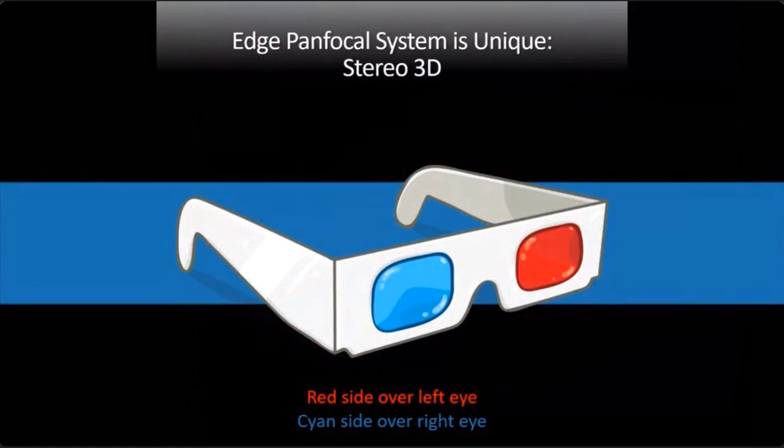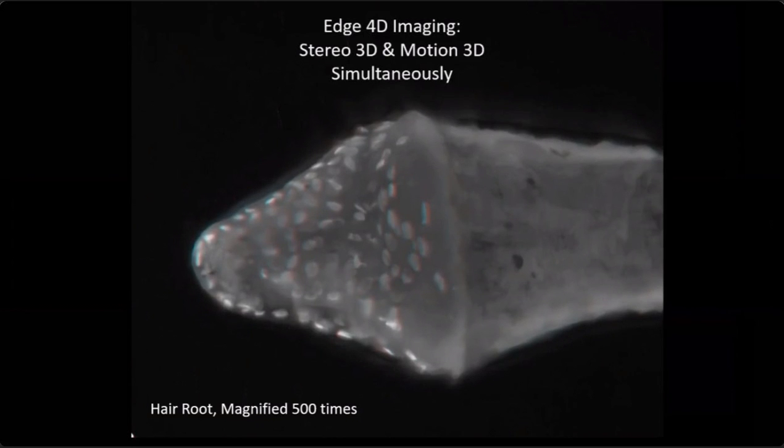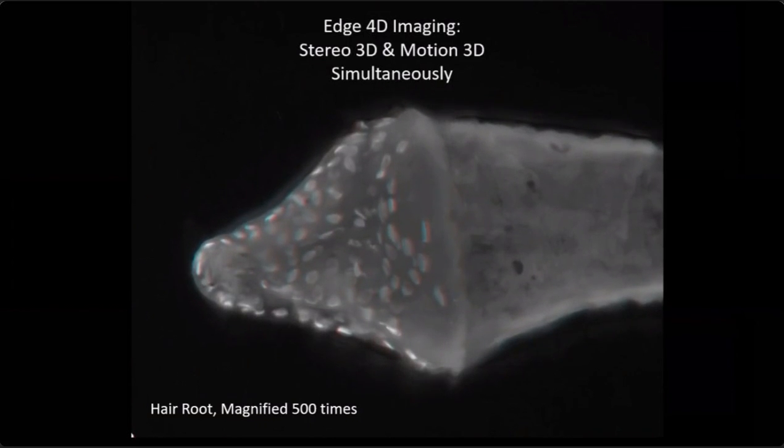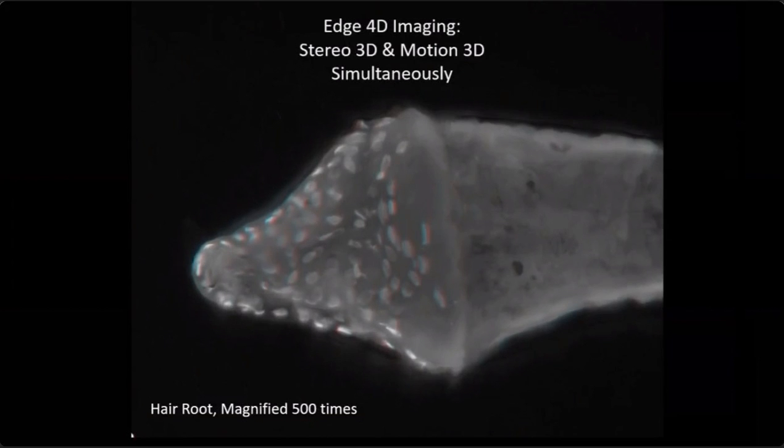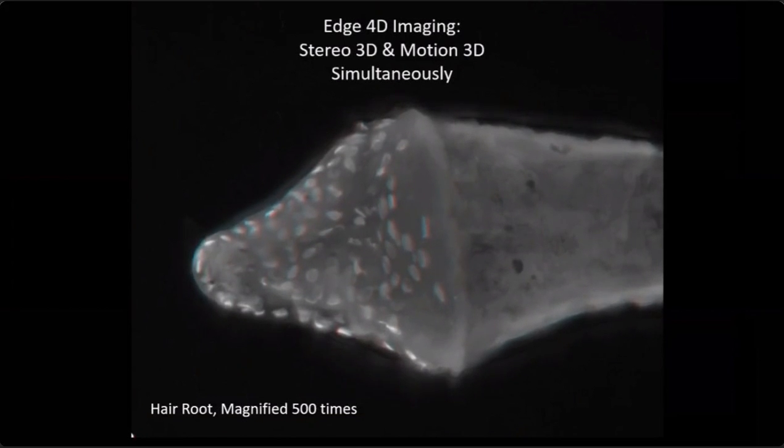Now, if you've got your glasses, please, I'm just going to go through a very quick little slideshow. It won't take long. Put the left eye with the red, and I'll show you some interesting little pictures here. So this is something that nobody else does. It's called Edge 4D imaging. So what this is, it's 3D stereo, and at the same time, it's tilting and rotating. So it's almost like a hologram in a sense.